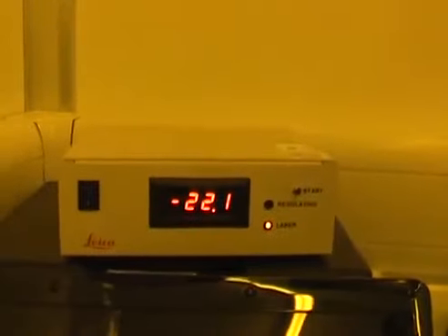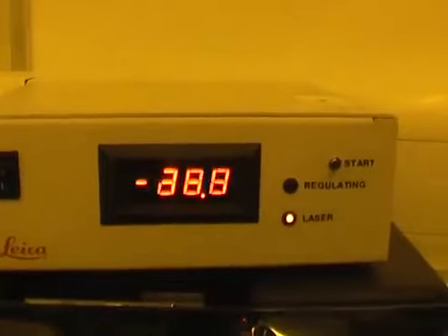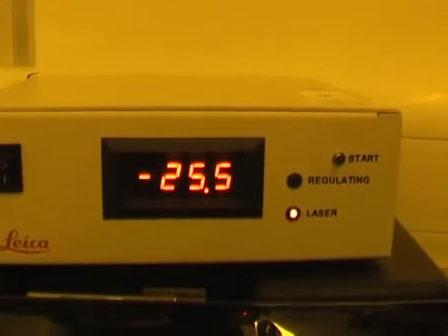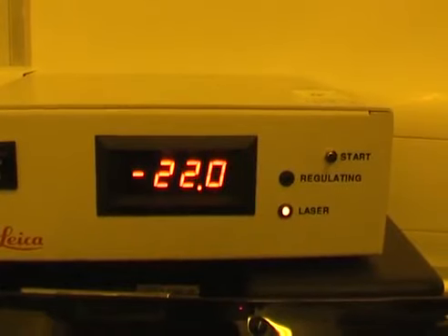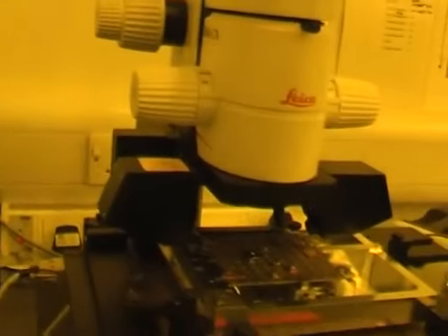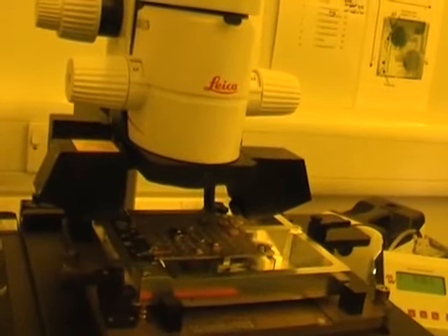There we are. Put the laser on. Now the height is pleasing. It's minus 22. It's quite slopey in that direction, but we've tried quite hard, and I'm going to assume in fact it's a small piece mounted on another small piece, and there's a limited amount we can actually do about that.